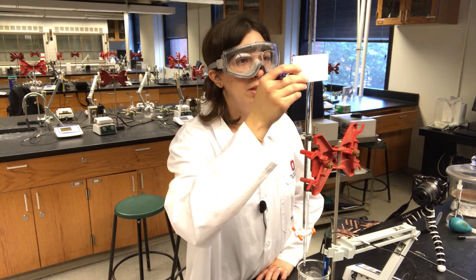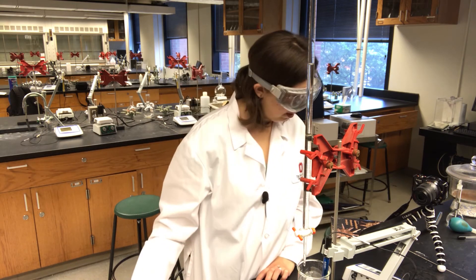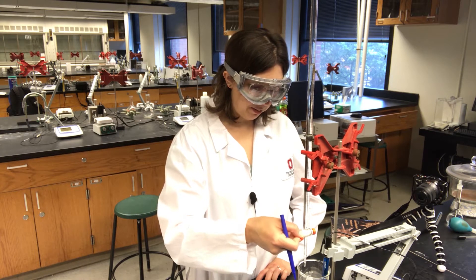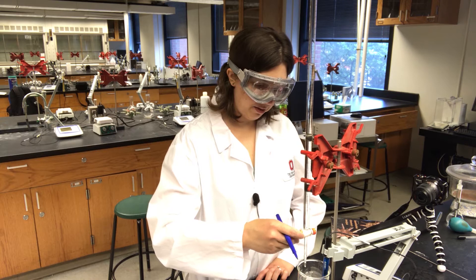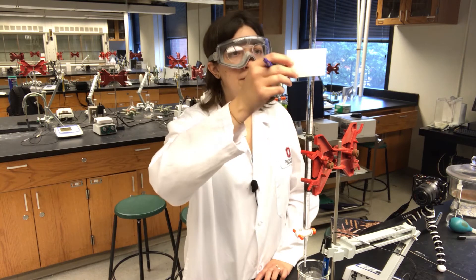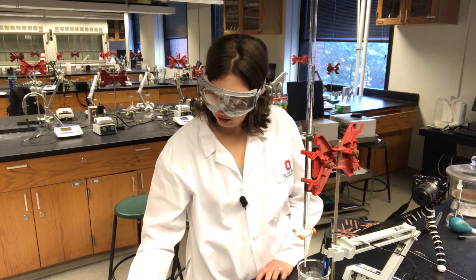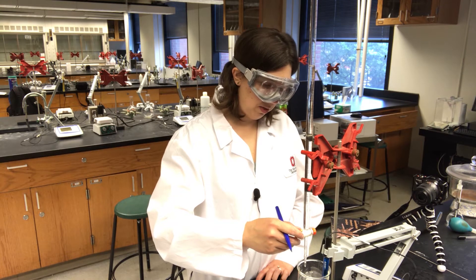Okay, here we go — we're getting closer now. At 22.26 mL the pH is 4.91. I'm going to try to add just a tiny amount — not even watching the measurement — just add one drop and see where we go. Nothing too exciting there, so I'll add two more drops. At 22.45 mL the pH is 4.99.